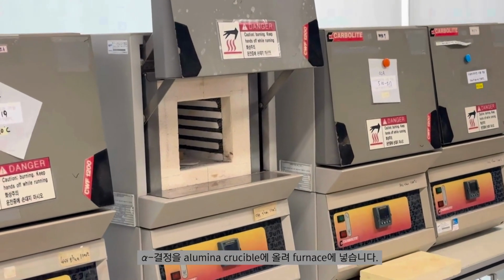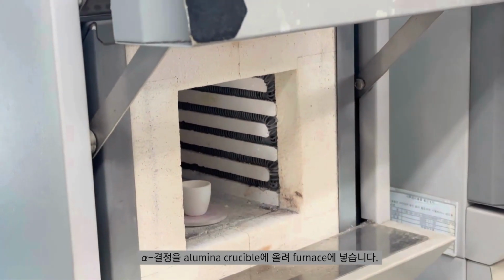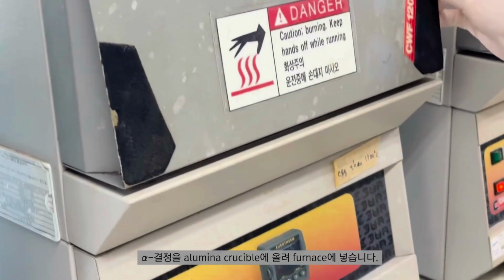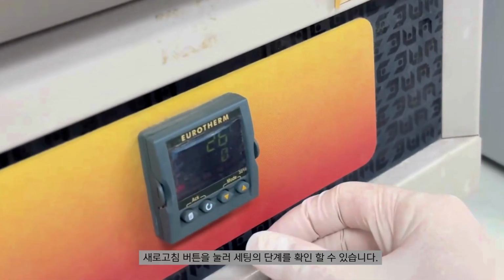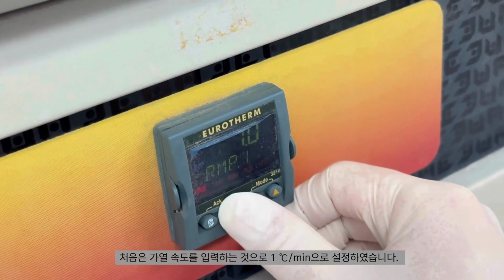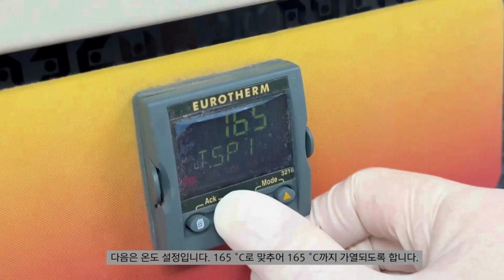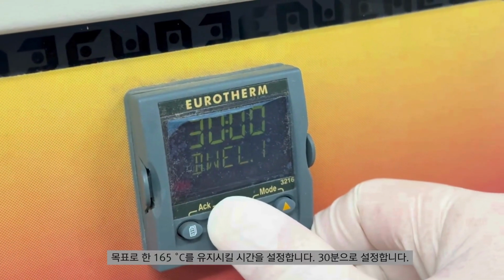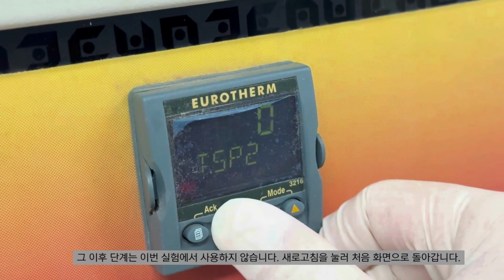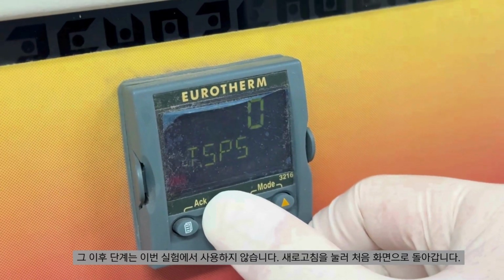Place the alpha crystals into an alumina crucible and put it into the furnace. Before heating, we have to set the furnace. By pressing the refresh button, we can check the setting steps. First, set the heating rate to 1 degree Celsius per minute, target temperature to 165 degrees Celsius. Then, set the holding time to 30 minutes. Remaining steps are not used, so press the refresh button to return to the initial screen.